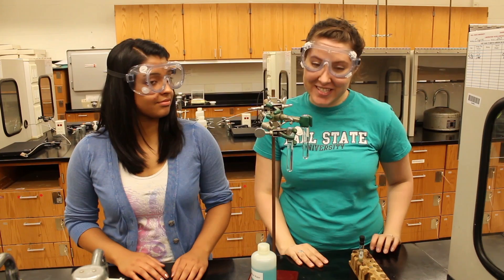In this lab, you will investigate the nature of water solubility in various organic compounds. Hydrocarbons are insoluble, but today we'll be using some other organic compounds, some of which have carbon-oxygen bonds. These carbon-oxygen bonds are polar, which helps make them soluble in water.